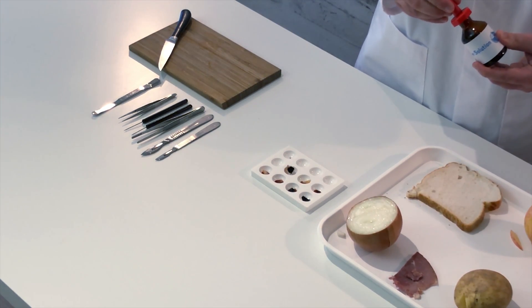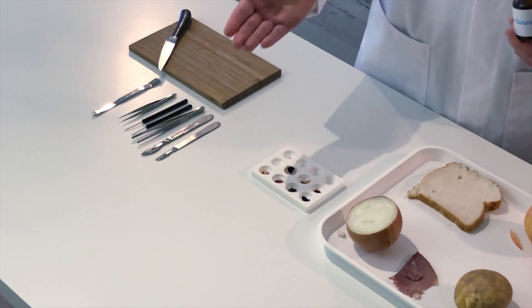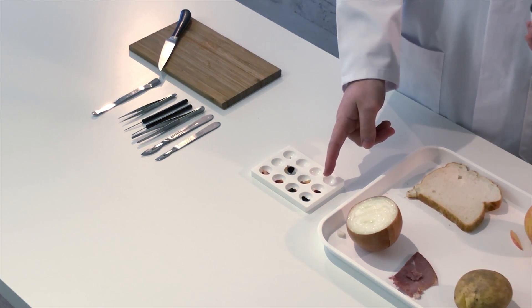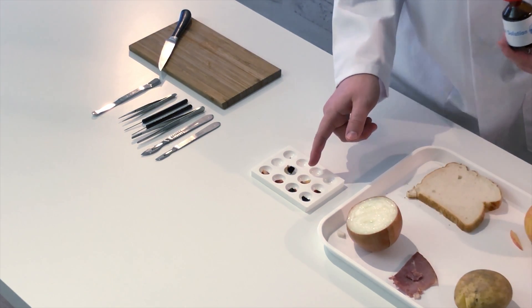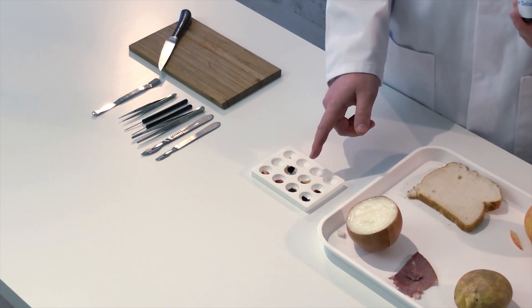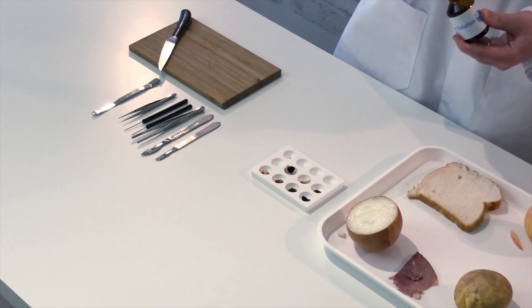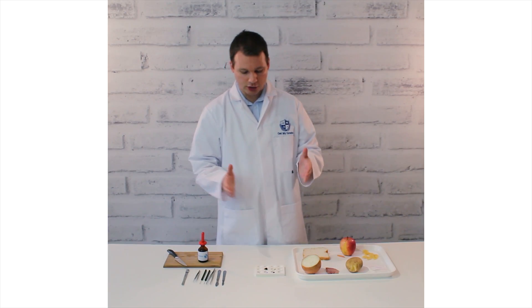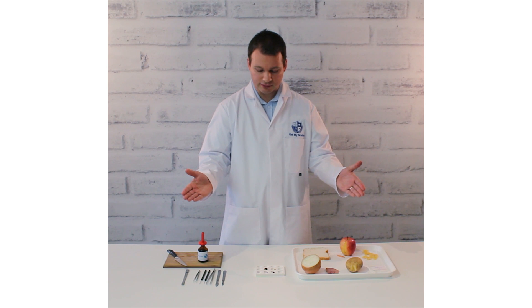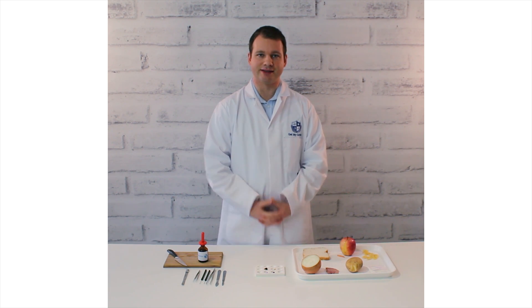Look at that. Very, very nice, clear results. Very, very quick, very easy. The pasta's gone blue-black. The apple, barely any color change, a very tiny amount, so very little starch. And then obviously the bread, completely blue-black straight away. Very nice and easy. Shows whether the foods have starch in or not. Takes a few seconds. And that's how you do an iodine test.